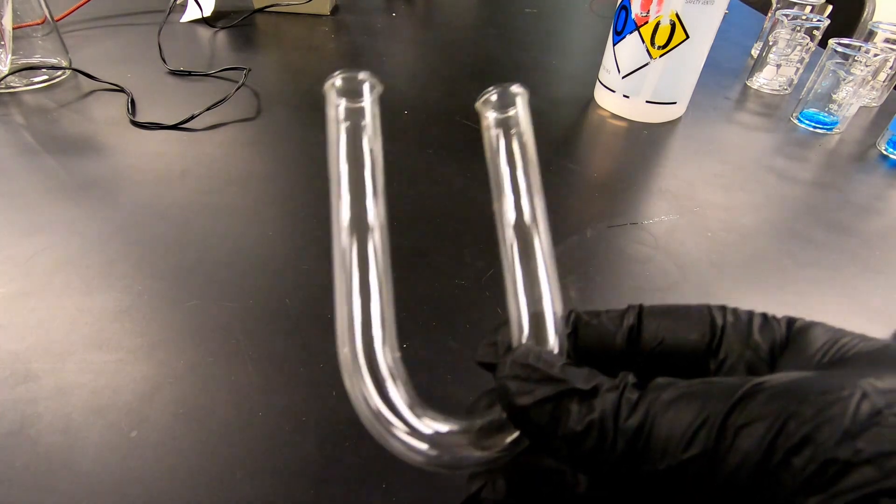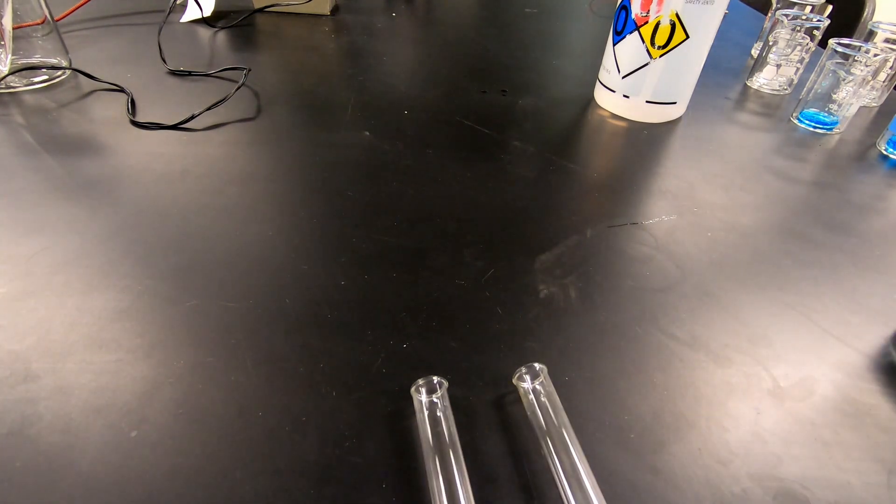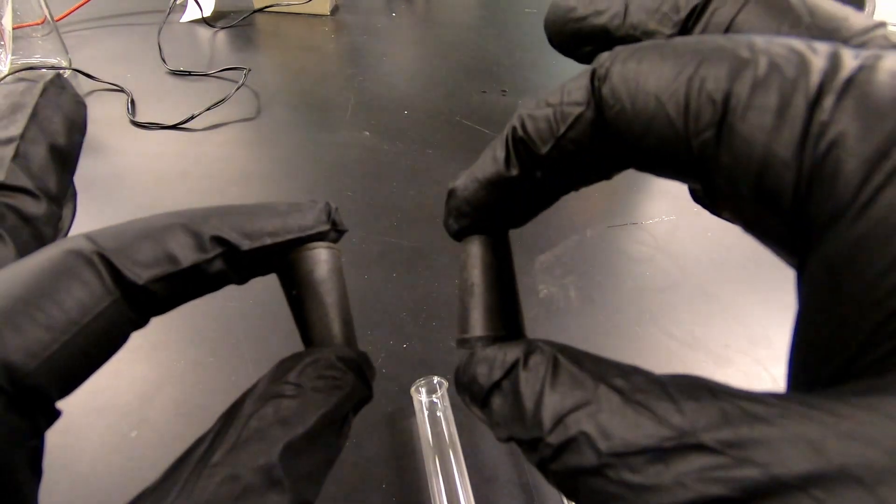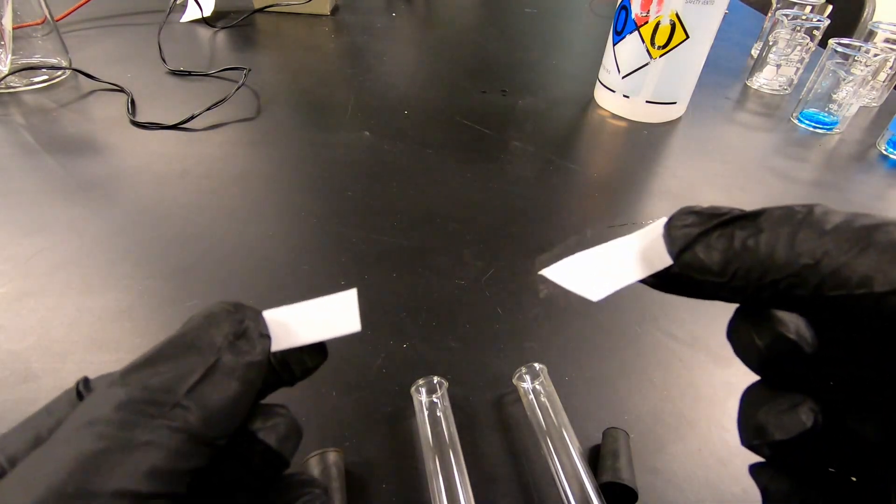We got our U-tube, a tube shaped like a U, two rubber stoppers, and two pieces of filter paper.